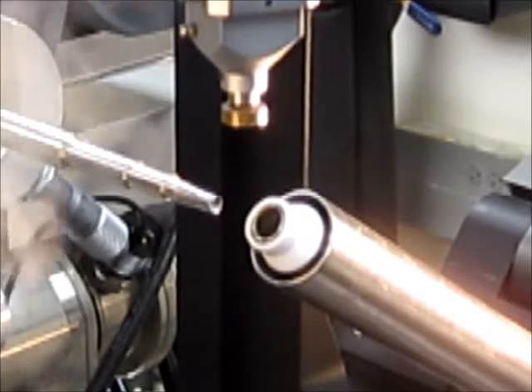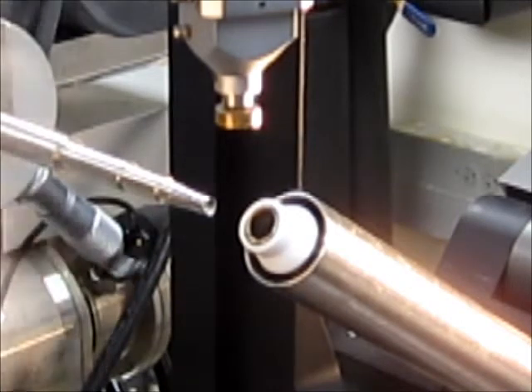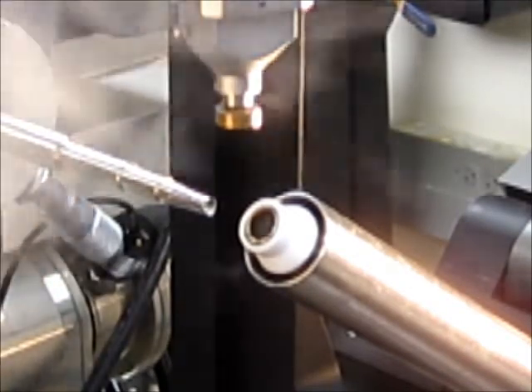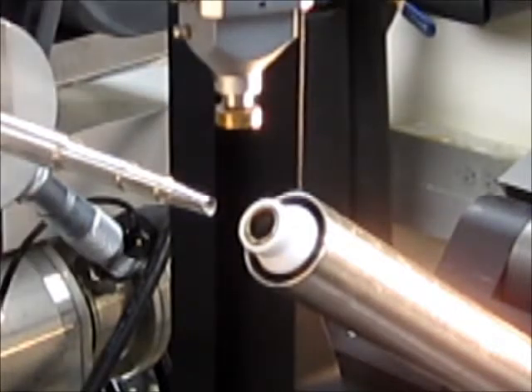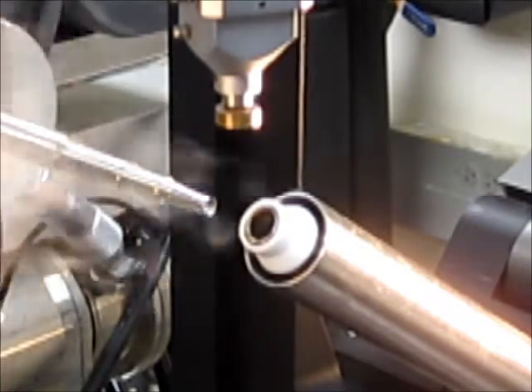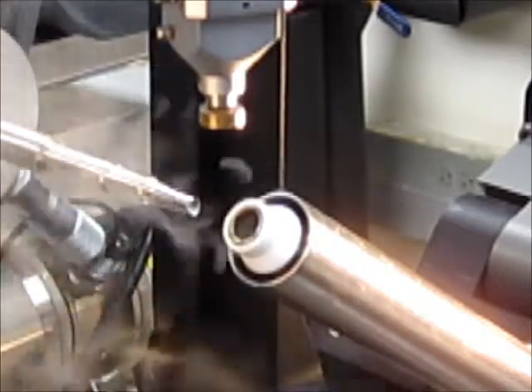Once again you can see the cryostream coming out of the cryostream tube. Right now I am going to pick my crystal which is protected in cryobuffer ready to go. And I am going to use the blocker to block the stream and put in the crystal.